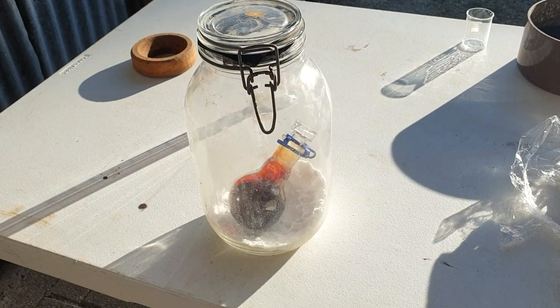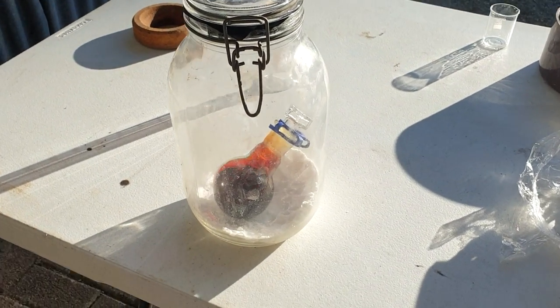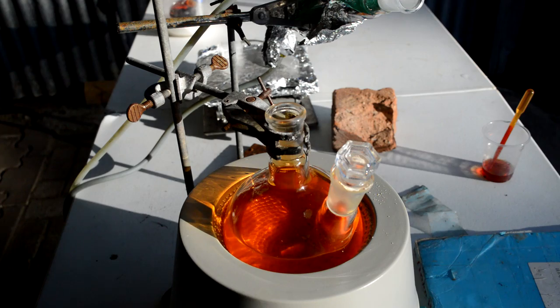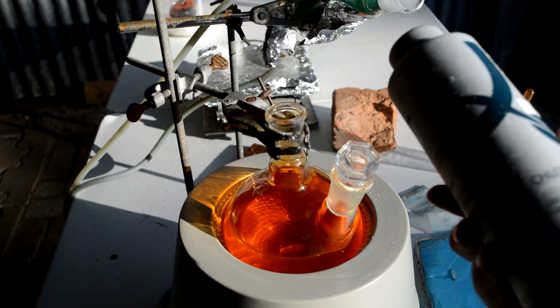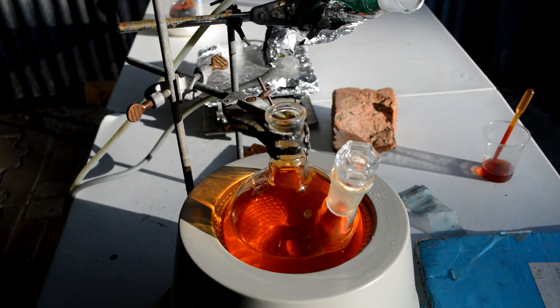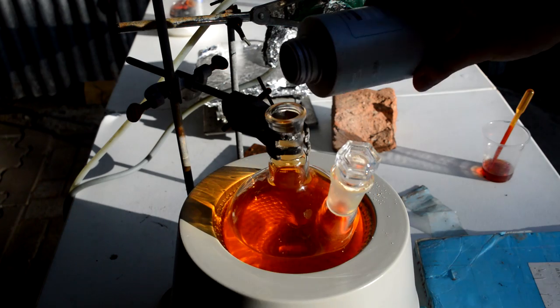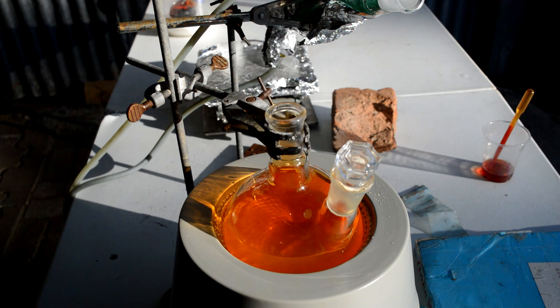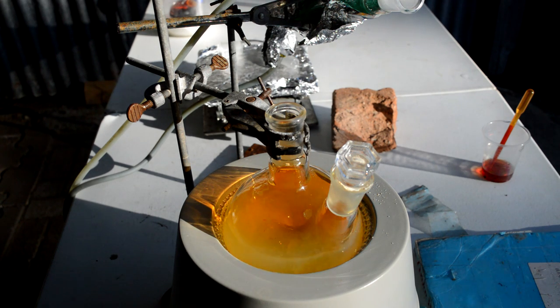All right, I'm going to neutralize this bromine solution with some sodium thiosulfate, chlorine remover—that's what it says on the front. It's going to be bromine remover. Should only take a couple of crystals. Beautiful.